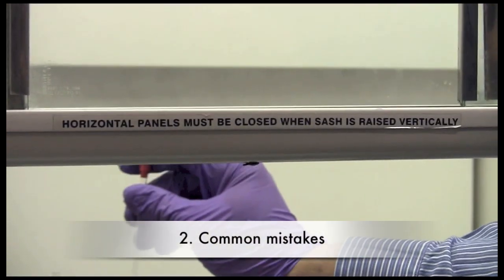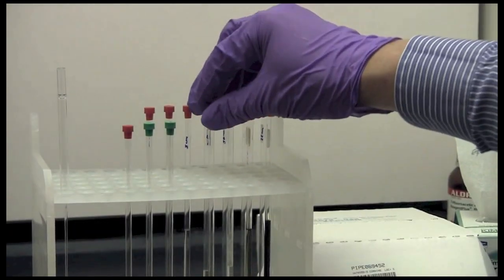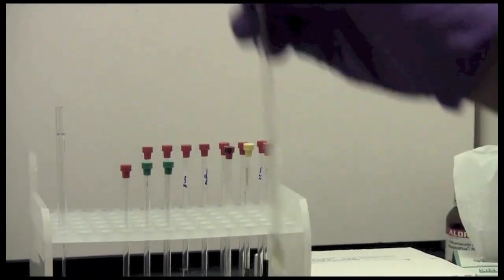This is what a properly prepared sample looks like and should give you reasonable data. Some examples of improperly prepared samples look like this. This sample is far too short. It will give you a very poor looking spectrum.